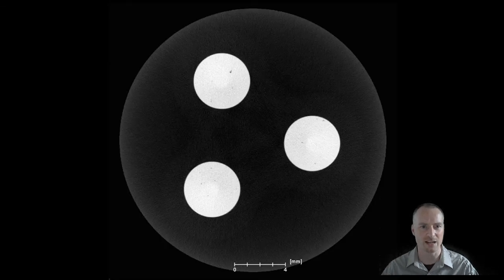In this example, we can see an ideal X-ray computed tomography reconstruction. The samples are in the centre of the volume. The container wall has been cut out to reduce the post-processing steps. The profile across the component is uniform, and the pores show a low grayscale value compared to that of the matrix phase. The reconstruction itself has been saved as a 16-bit file. 32-bit files also show high quality data. And the dynamic range is appropriate to what we want to look at in the final reconstruction.